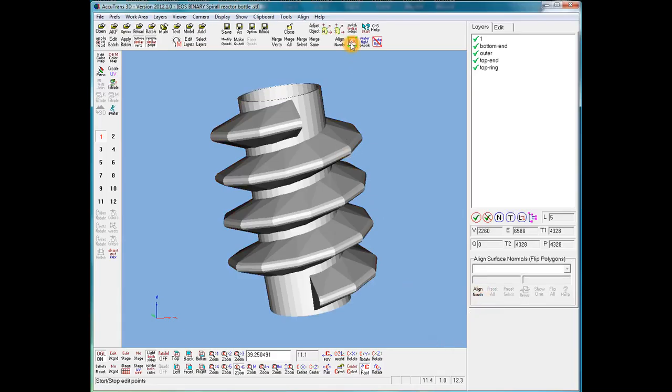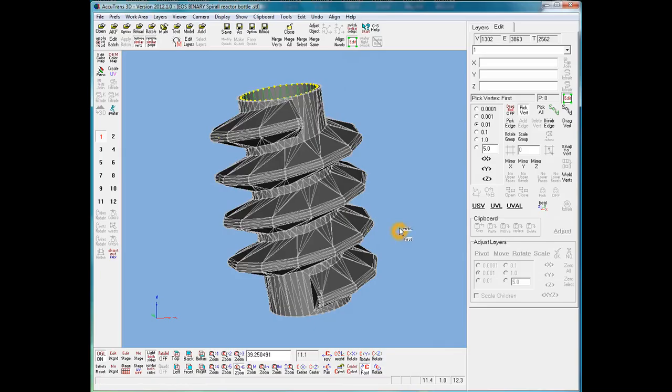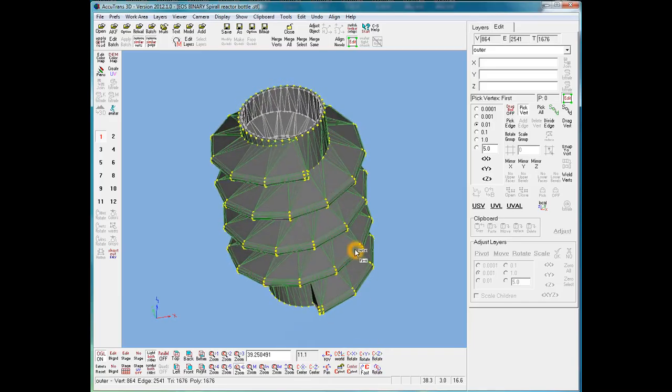Now we can go to the edit vertices mode and start going around to check all the surfaces. Now, for the outer surfaces, we could have done this without separating the model, but I left until this stage to do that. So now, to make this layer, the outer shell, the current layer, hold down the shift key and click the right mouse button. And, oh, there we go. I sometimes have trouble when I'm capturing to get it to work just right, because I think I'm between frames or something going on.